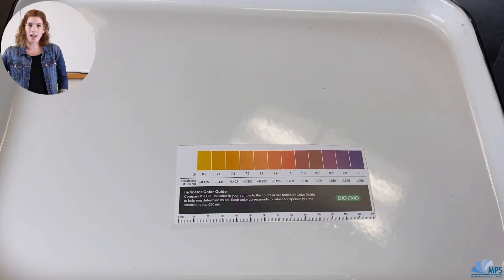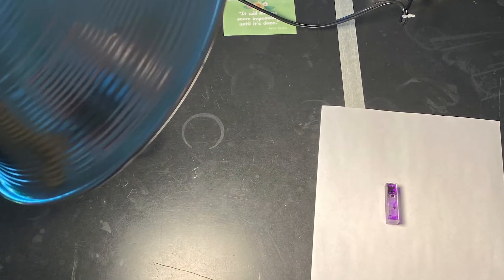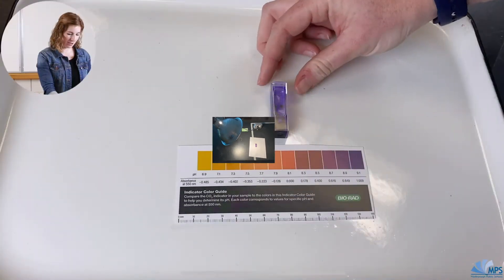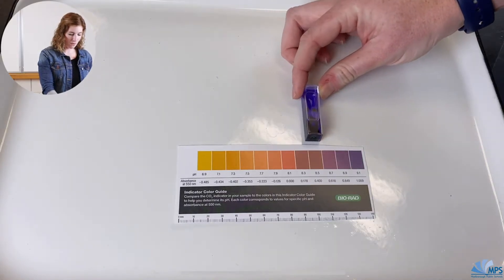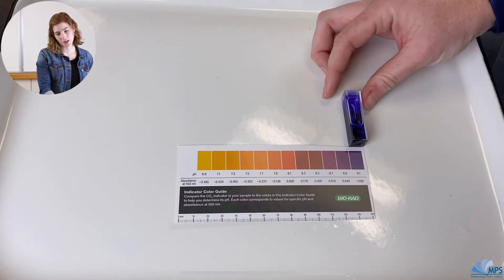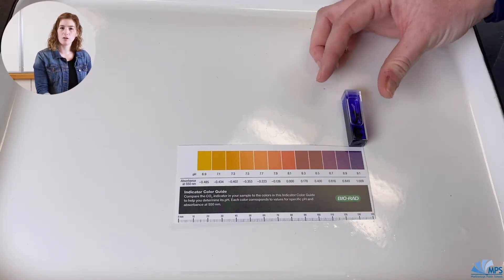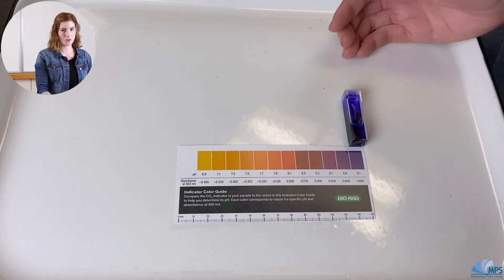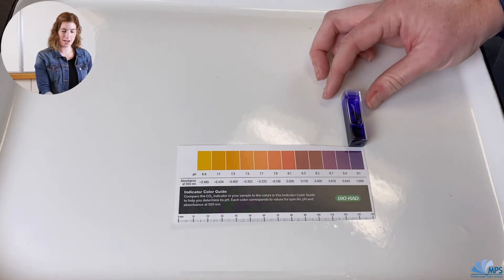Next we'll take a look at what happened when I put the algae beads in the carbon dioxide indicator under a white lamp. You should be able to tell there is a massive color change — we have a very deep purple color. If I match it up with my scale, it comes all the way to the end: 9.1 is the darkest purple color on this pH scale. This pH scale isn't a full 0–14 scale, but this brings us to 9.1.